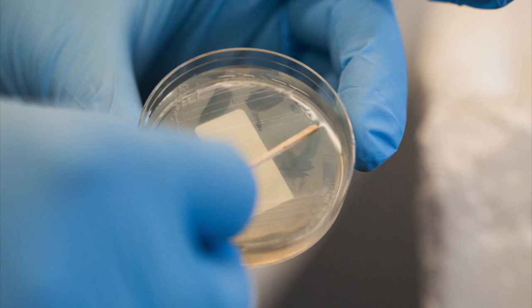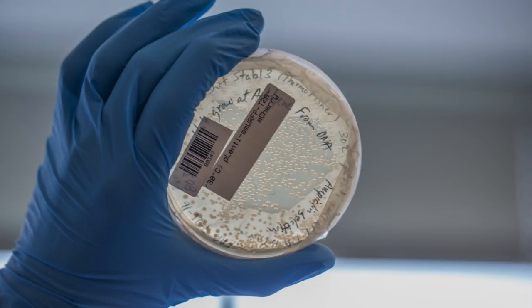LB agar plates are commonly used to culture individual bacterial colonies from freezer stocks or to select individual populations from complicated bacterial mixtures.